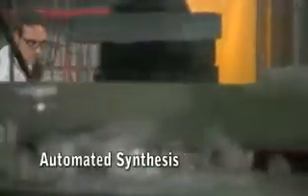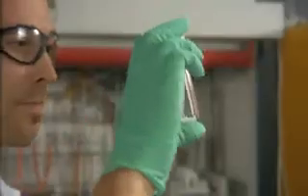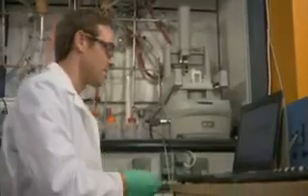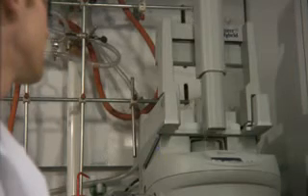In the center of a fully remote controllable lab is an automated microwave synthesis reactor. Cadmium selenide quantum dots are synthesized. Control over reaction temperature, heating rate, pressure, and by using standardized reaction vessels allows for a reproducible synthesis. All parameters are digitally detected and recorded.